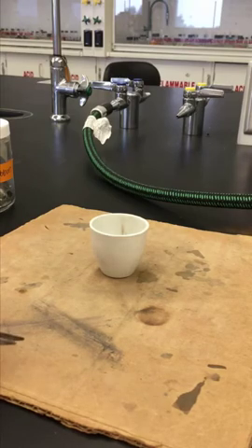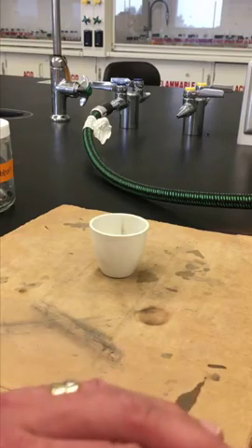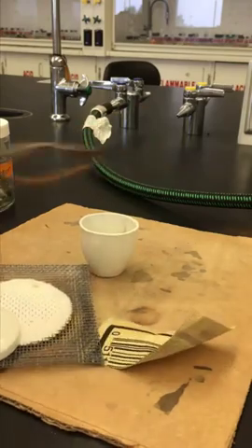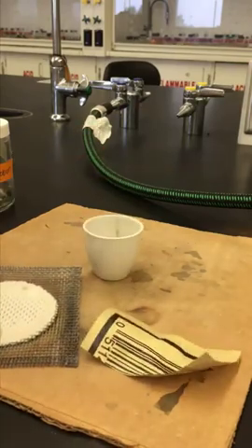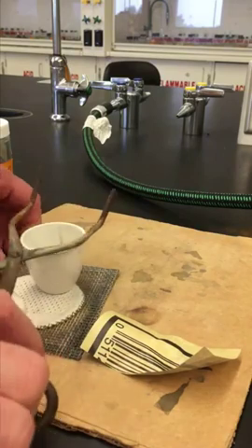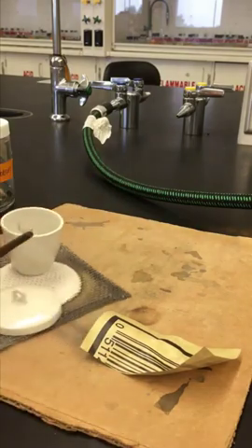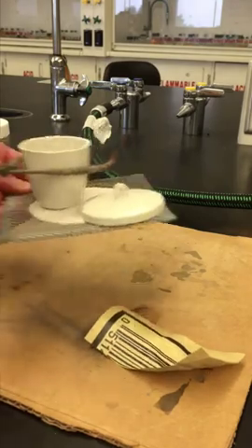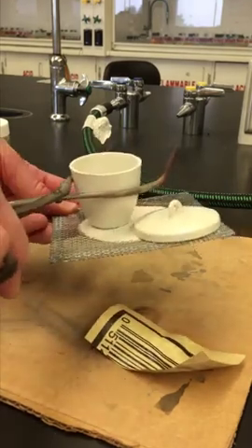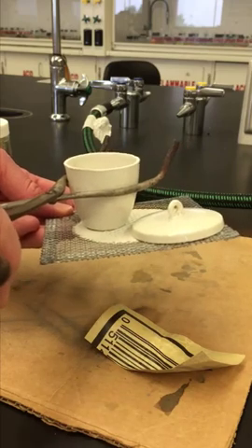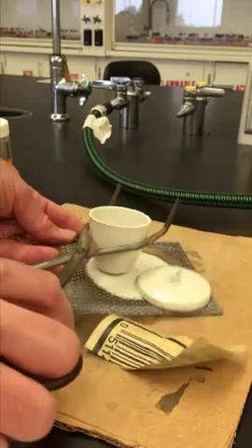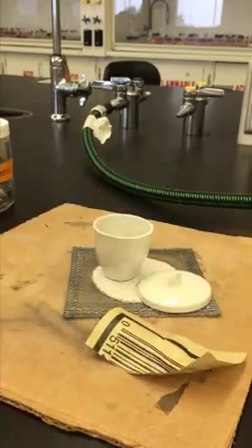Once we have the metal sample ready, take your crucible with the magnesium in there. Again, I can't touch anything with my fingers. Because the oil on your fingers will affect the results. So get ready to take this to the balance room. Make sure you carry your sample securely. Bring it to the balance room and get the mass of the lid, the crucible, and the magnesium sample. After you get the mass, we will get ready to fire it.